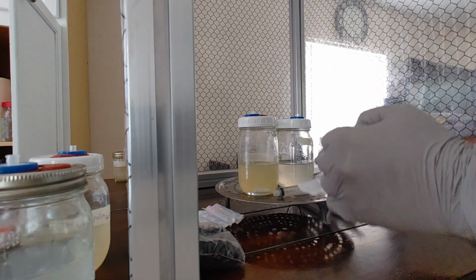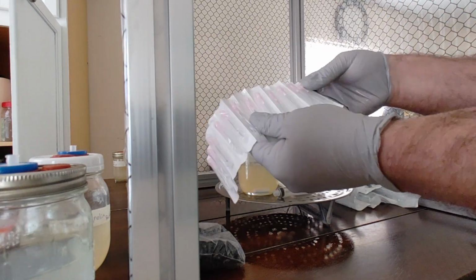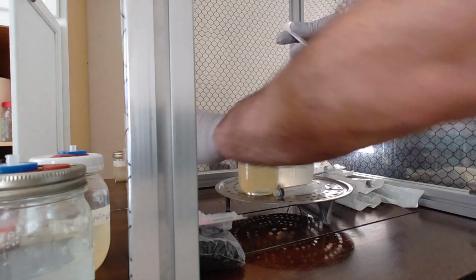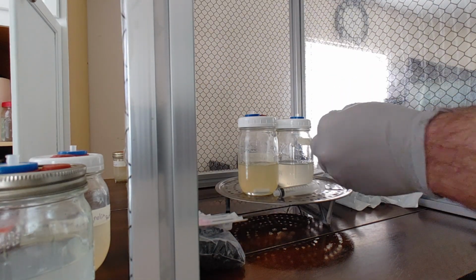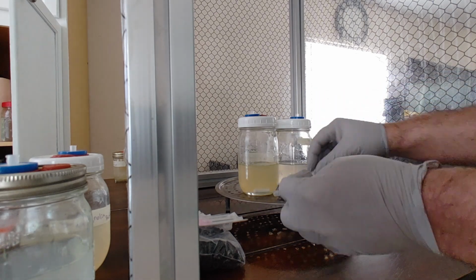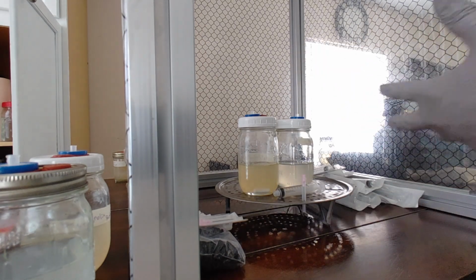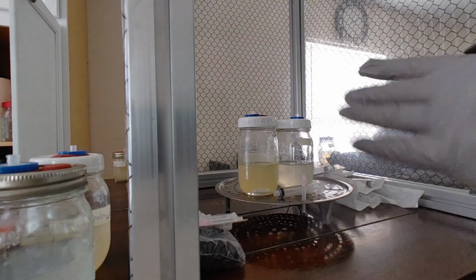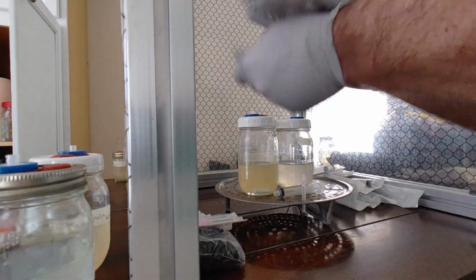And these already come pre-sterilized, so you shouldn't have to burn the needle or nothing like that. Not on the first time. And I don't know if you can tell or not, but I'm doing all of this inside the hood. Just for giggles, I'm gonna spray my hands down one more time.